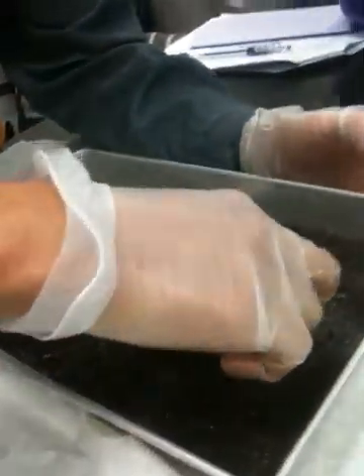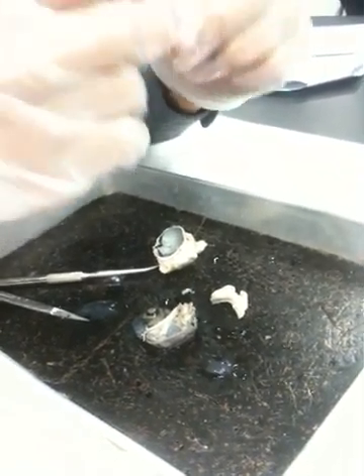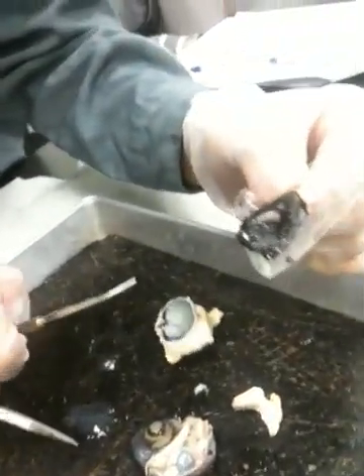You guys see that? On one side it's completely black and it has these kind of radiating folds. What is that? That is the ciliary body. So that contains those ciliary muscles that we talked about, right? This is the ciliary body.